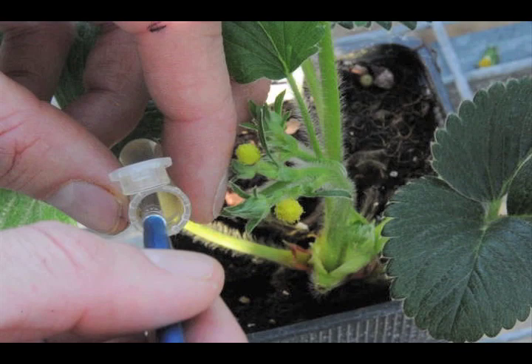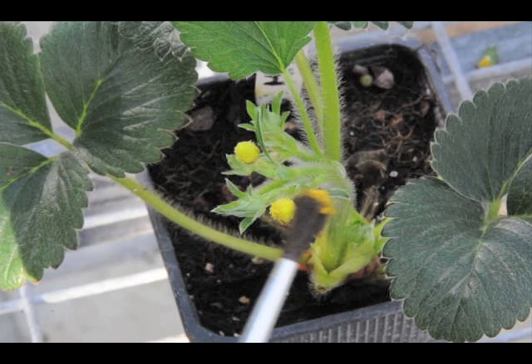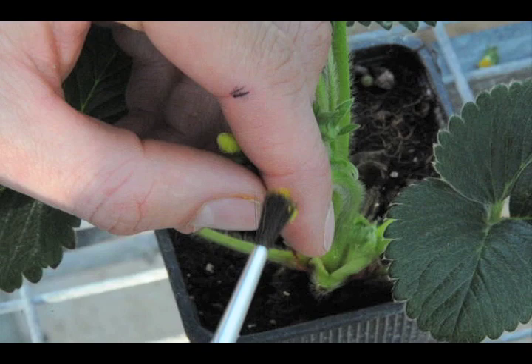The other way to manually pollinate is demonstrated here. Using a brush, the pollen is taken from the eppendorf tube and applied to the female receptacle of the chosen plant.